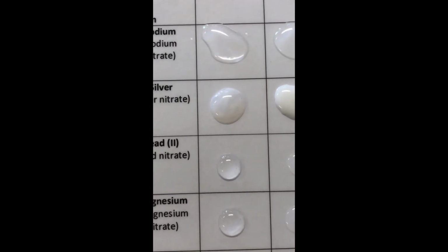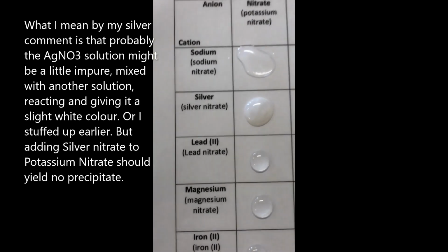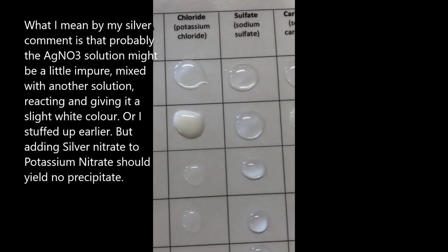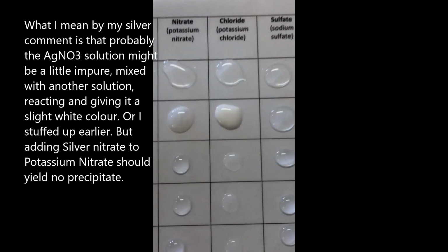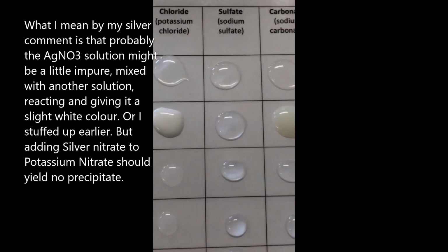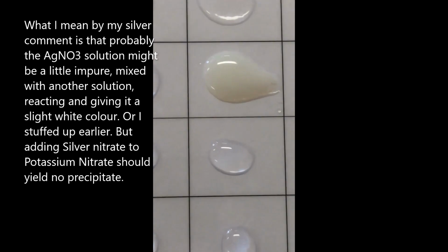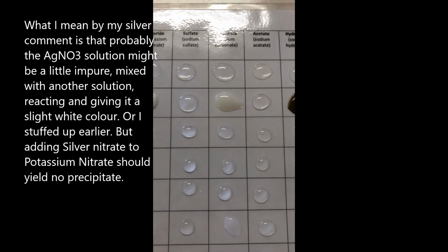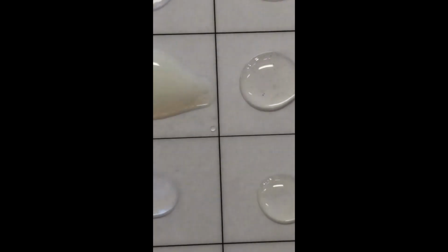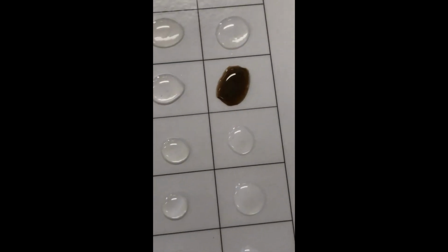So silver nitrate, we've had a little bit of cloudiness, but I believe that's probably to do with the silver more than anything else. We can clearly see there, silver chloride is a nice milky color. Sodium sulfate, again, we've got completely clear. Sodium carbonate, we have got a milky solution, so that shows you we've had a precipitate formed. Sodium acetate, nothing, which means silver acetate has nothing. And sodium hydroxide, we can clearly see silver hydroxide is being produced and we get a nice brown color, which shows you that's a precipitate.